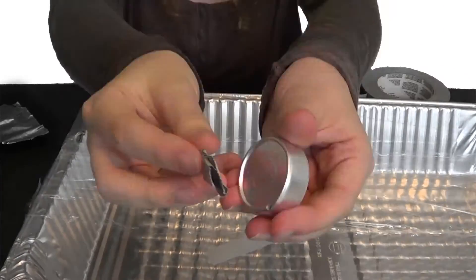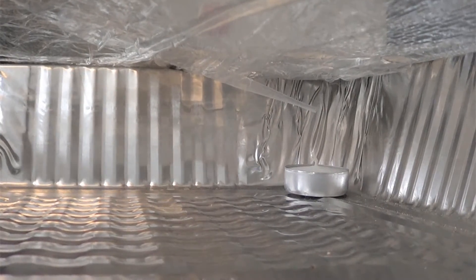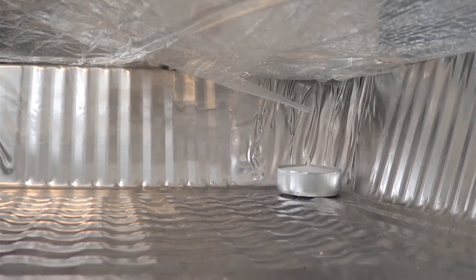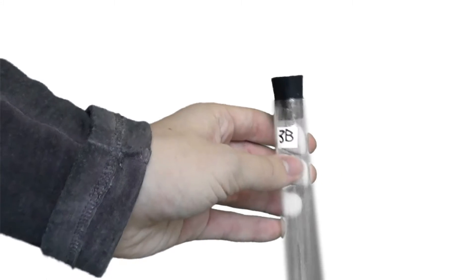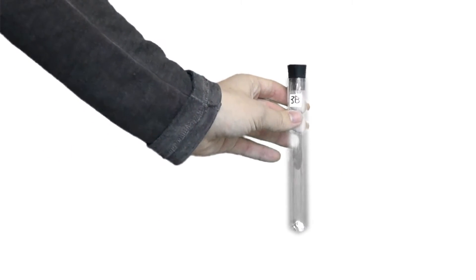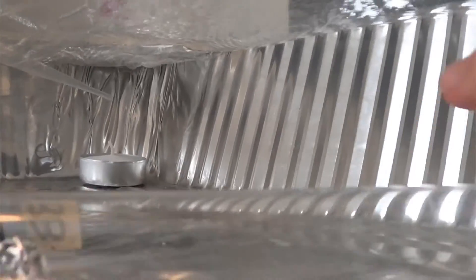Good job! You have all your presets done. Now it's time to move on to what you'll actually be doing on the day of the experiment. If you're using a desktop computer instead of a laptop for data collection, be sure to move your module to a clear space beside it. Don't forget to wear goggles or any protective equipment necessary. Place your candle in the pan and make sure it's underneath the aluminum cover — the aluminum is there so that the flame doesn't melt a hole in the plastic wrap. Take the objects or specimens you want to place inside the environment and put them anywhere in the pan, just not too close to the sensor or the candle.